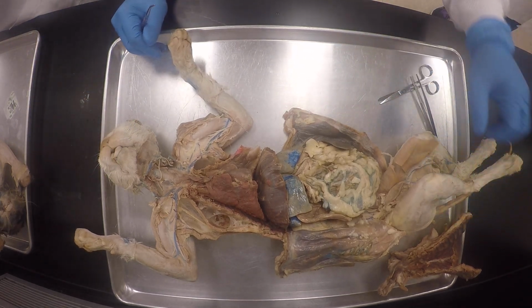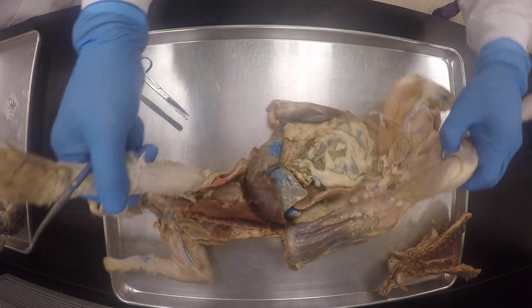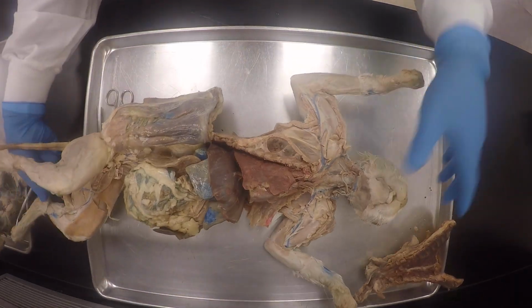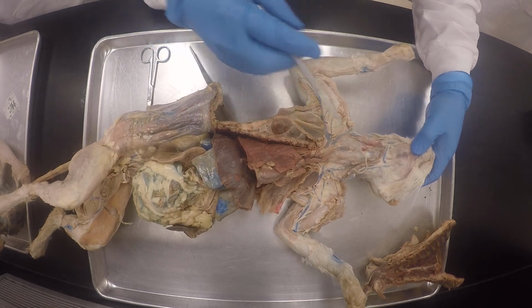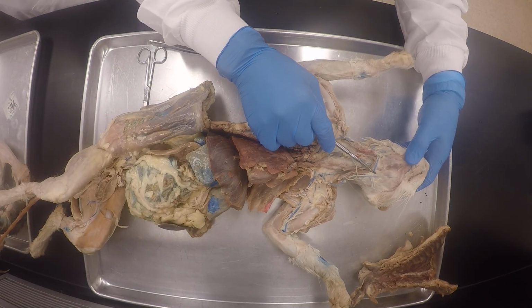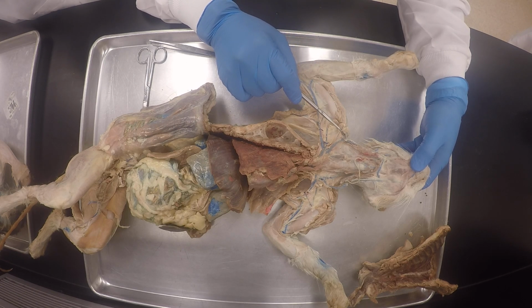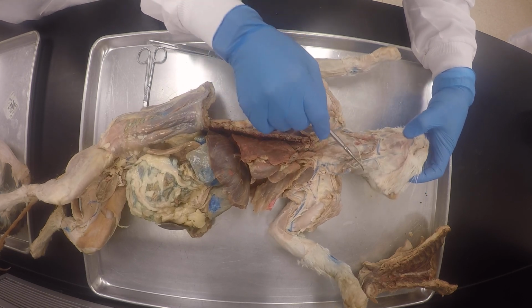So I'm gonna go ahead and do the cranial blood vessels, arteries, and veins, and then you guys can chime in if you know, because the answers are on the board. So we start with the cranial veins, since this is what we did. What would this be? That would be the transverse jugular vein. What about this one out here? Posterior facial vein. This one, external jugular vein.